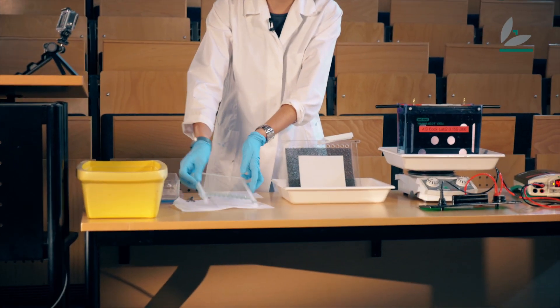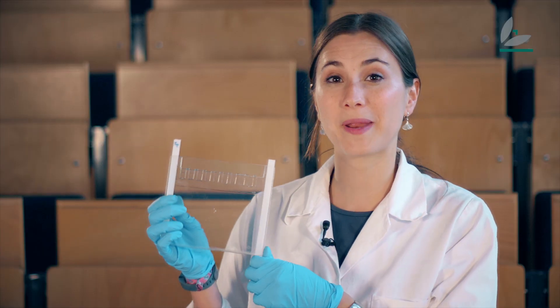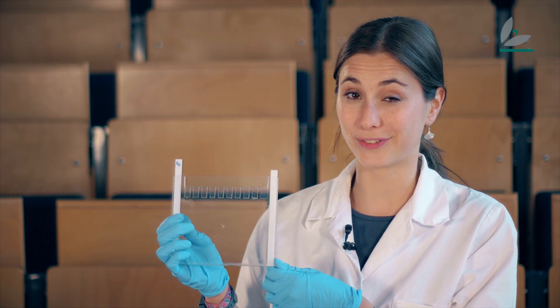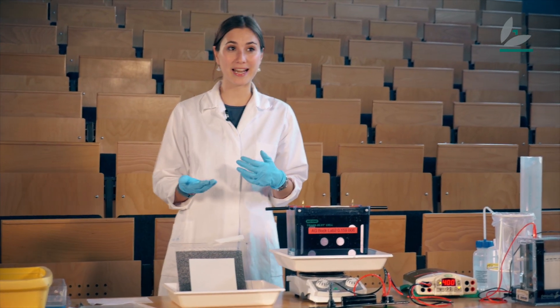I have separated my proteins in this gel with gel electrophoresis. I have already explained how gel electrophoresis works in another video. The proteins are trapped in the gel, so in order to analyze them I have to transfer them to a membrane.